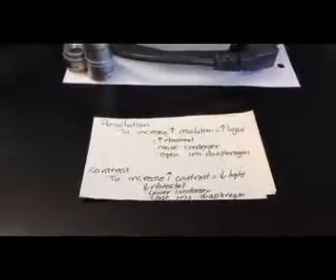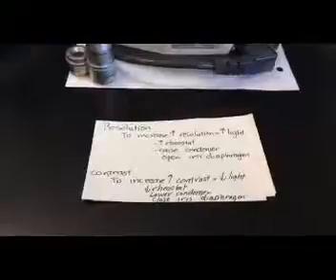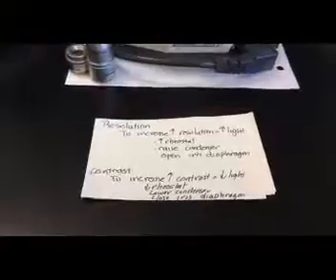And there's 3 ways we can do that. We can increase the variable light control, increase the rheostat. We can raise the substage condenser, which we'll show you here in just a bit, and the substage condenser will help focus light on our specimen. And the third thing we can do is open our iris diaphragm. You'll recall the iris diaphragm acts like the pupil of our eye, and by opening the iris diaphragm, we're going to permit more light to strike the specimen.